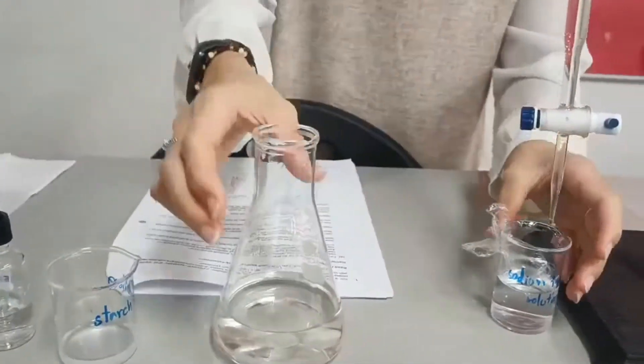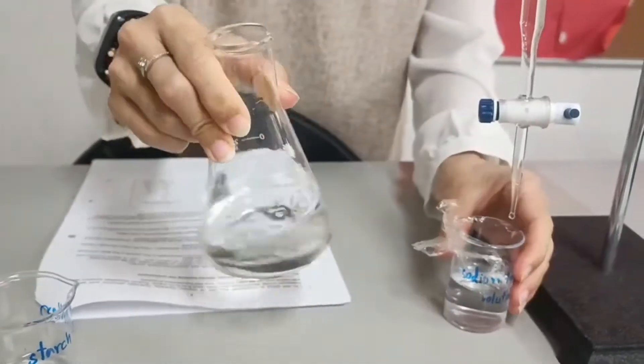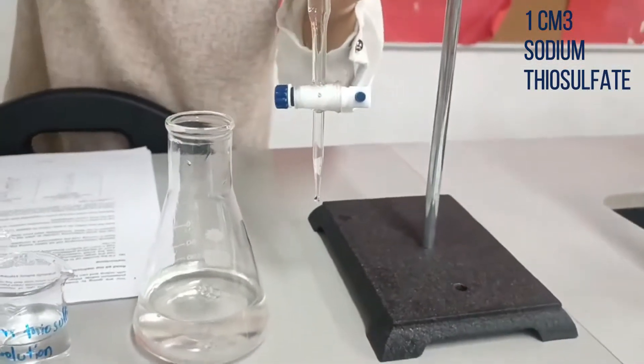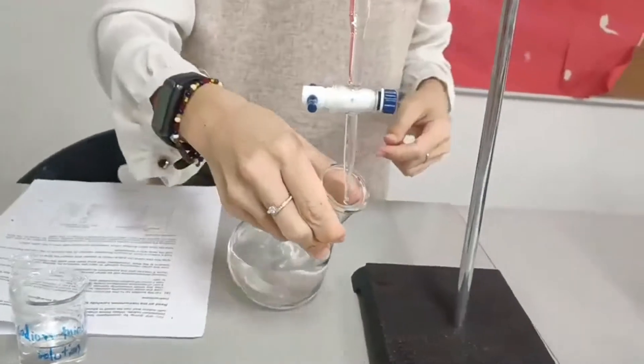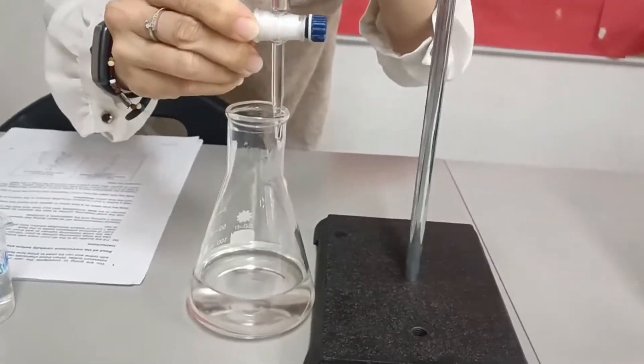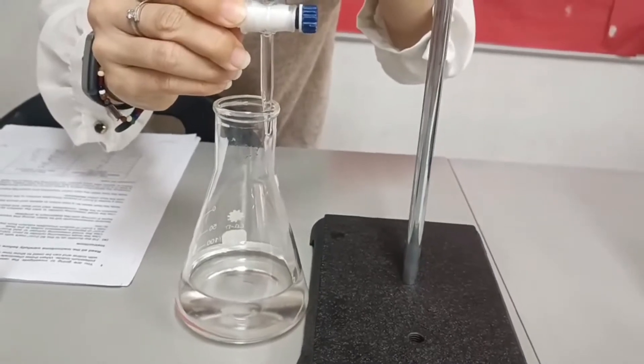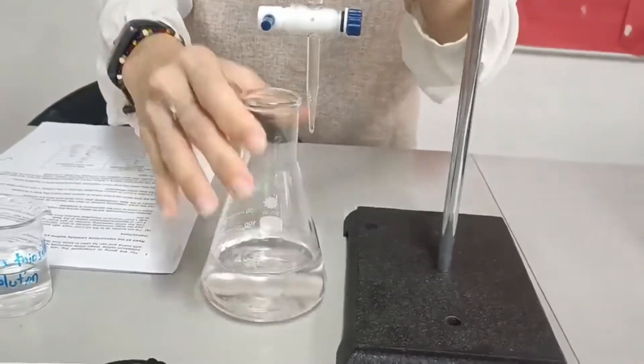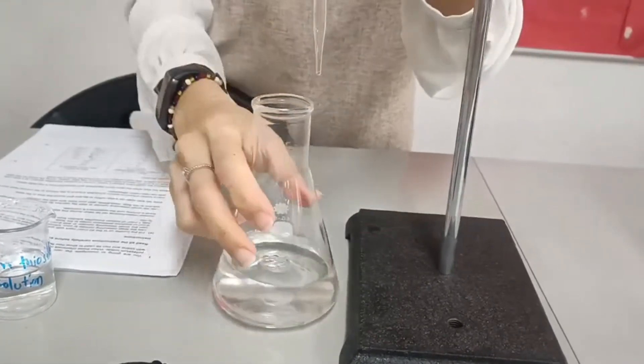Now I need to add 1 ml of sodium thiosulfate from the burette. Swirl.